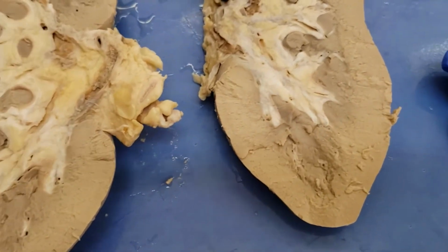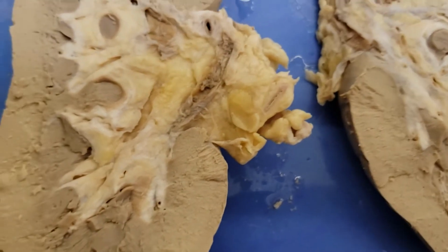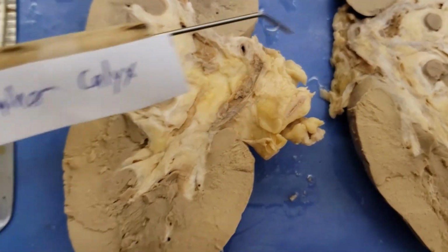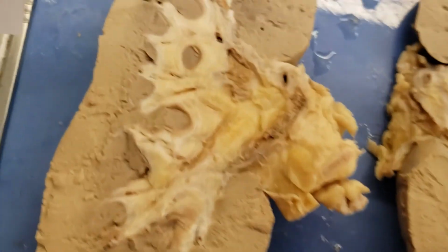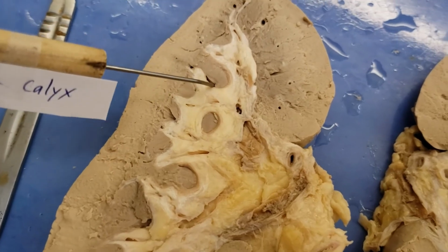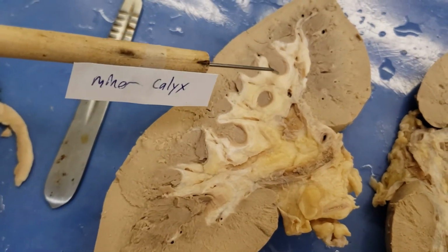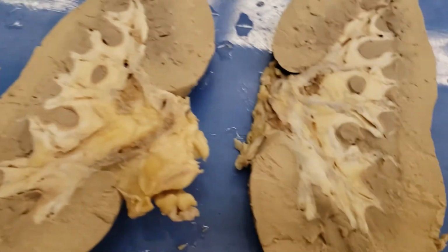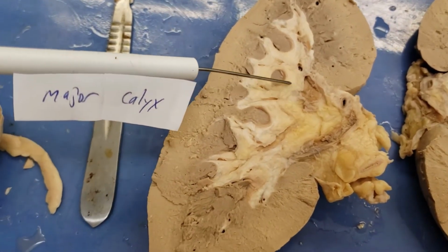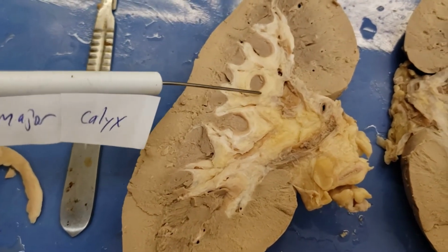After urine is formed, it goes through the cortex, then leaves via collecting ducts, which pass through the medulla, and then it has to exit the medulla and go into this open cavity, this open space. This leads us to the first of those structures, the minor calyx. This is the beginning of the urine dumping ground, and it occurs right in these areas underneath this spot. So the urine just pours into there. A few of these will dump into another structure, but this is the minor calyx right around there. And the major calyx is this region down here. It's where you have several of these collecting ducts dumping into one spot.